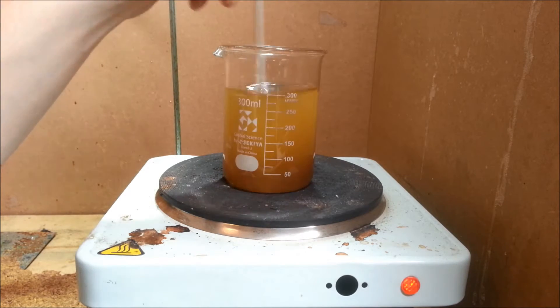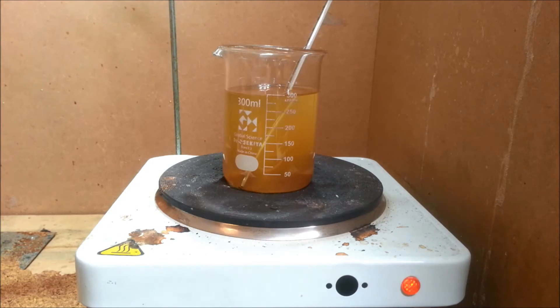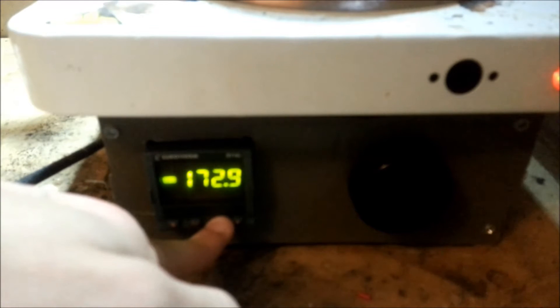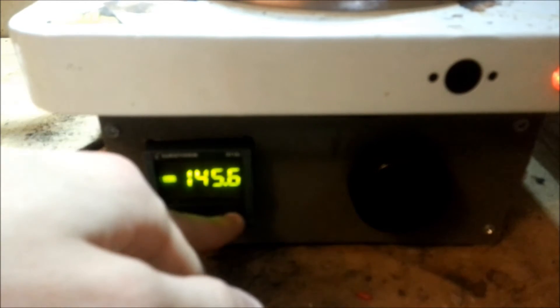The 10 grams used here will have low saturation because I wanted to see if it would reduce losses when filtering. But 20 grams of 80% sulfur to the same volume showed similar results to 10 grams, and both have yields close to 90%. The solubility figures here are estimates based on experiments, since solubility tables other than at STP proved difficult to find.